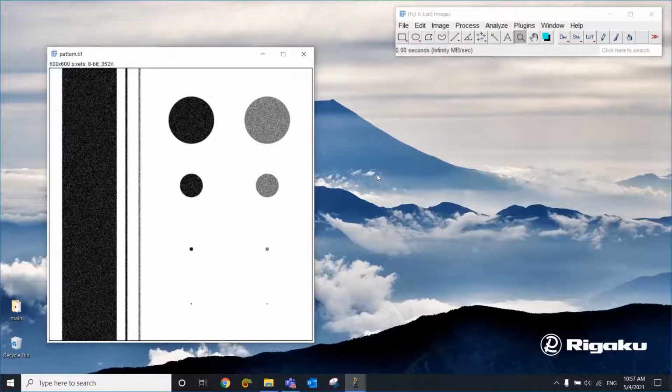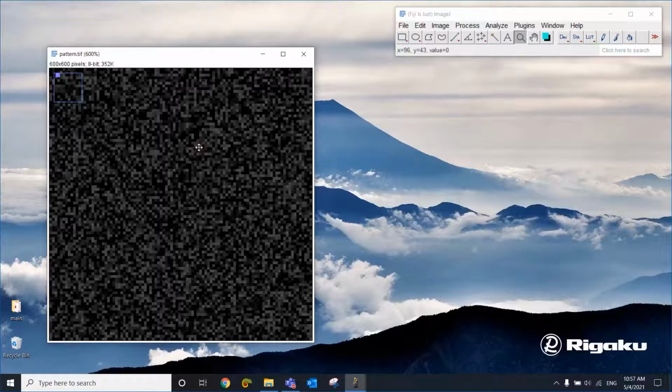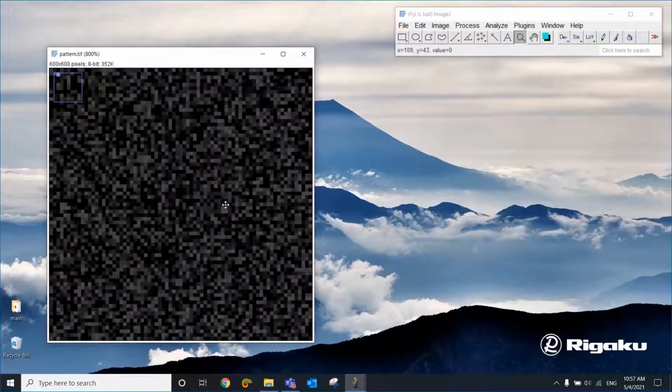So this image has black and gray circles, lines, boxes, and if you zoom into this area, you see quite a bit of noise. And let's say that we want to get rid of this. We can get rid of this noise by applying a smoothing filter.